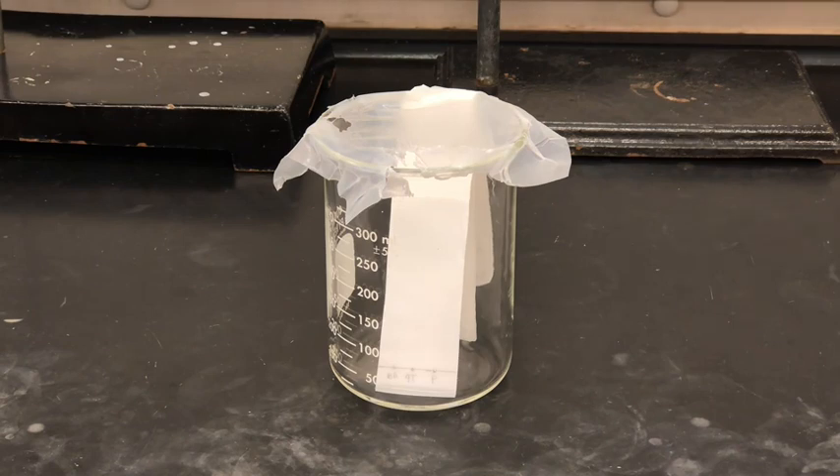As we near the end, I'm going to pull out the TLC plate and mark where the top of the solvent line is. You probably noticed that as the TLC plate was developing we couldn't see anything, so we need a UV lamp — this will allow us to visualize the plate and compare how far the reactants traveled versus the products. The reactants traveled quite far up the plate; there's even a large blob at the top so I might have oversaturated them. The product, on the far right side, did not travel as far. I'm going to circle all of the different dots that I see.